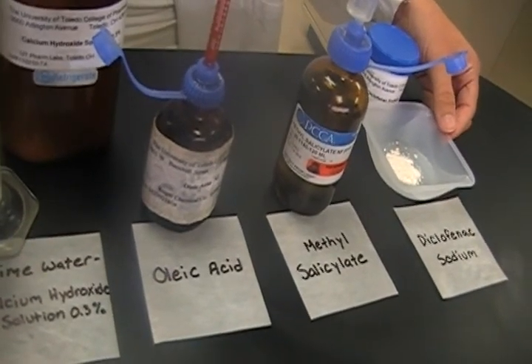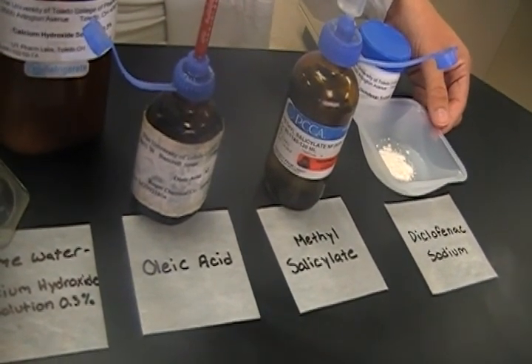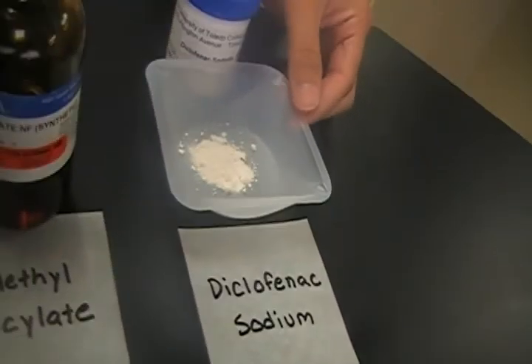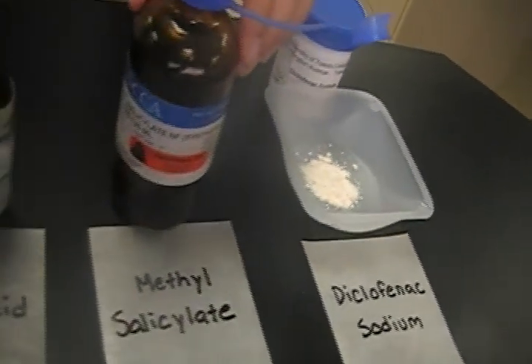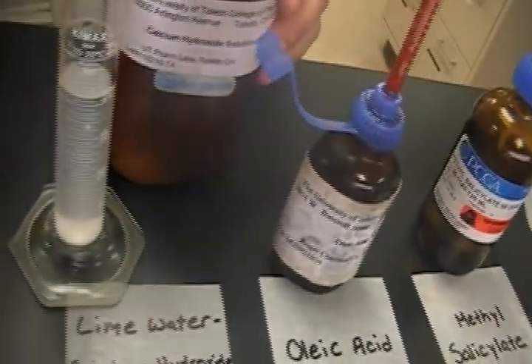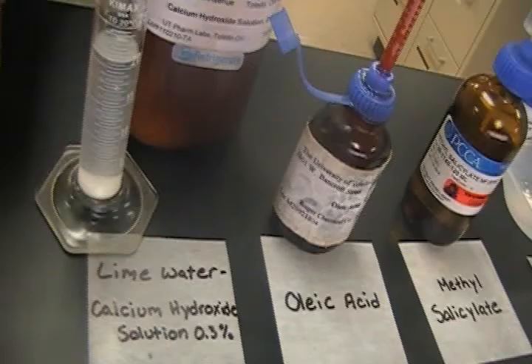Today we will be making an in-situ emulsion dosage form. Our ingredients for today are diclofenac, methyl salicylate, oleic acid, lime water, and olive oil.